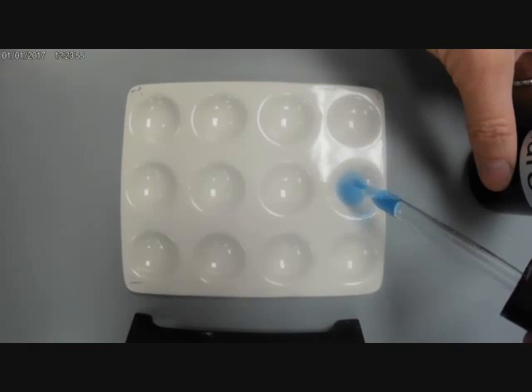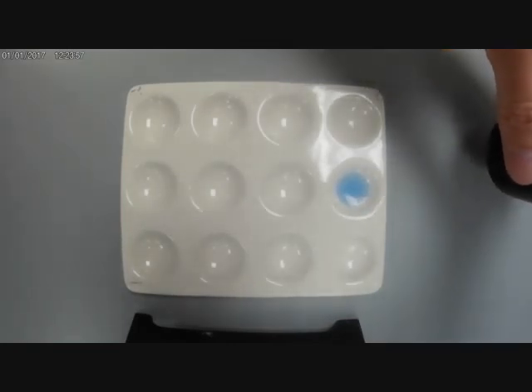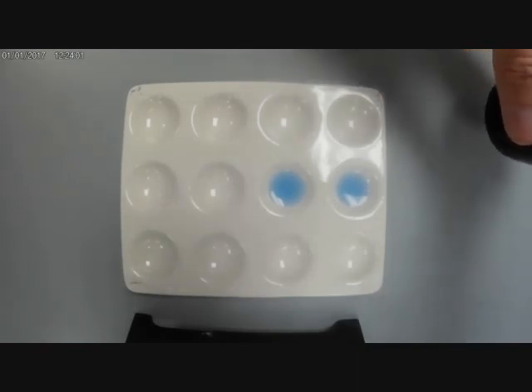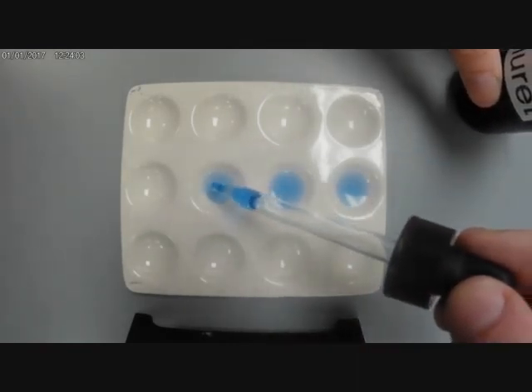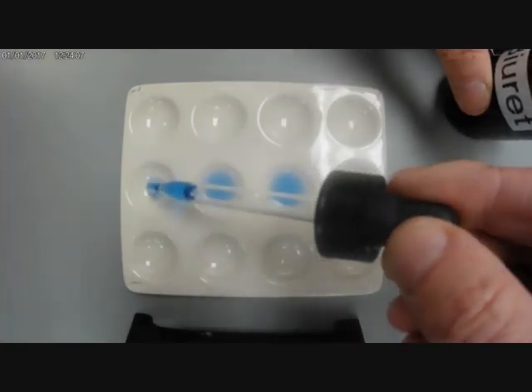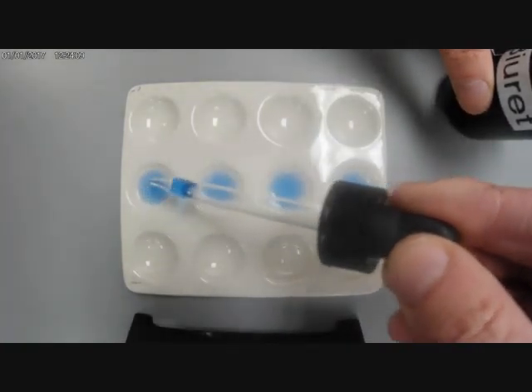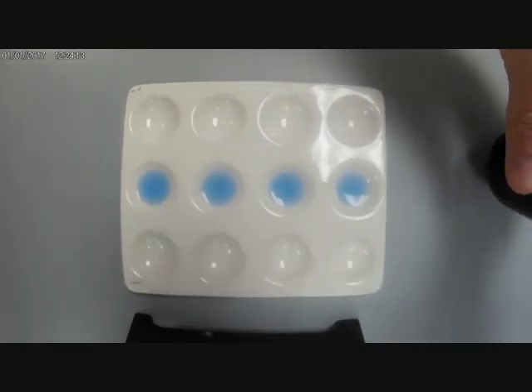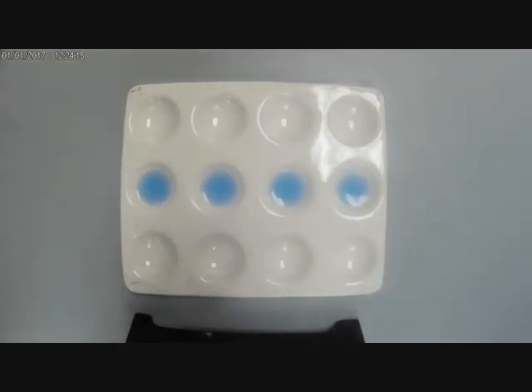I'm going to put some drops of Biuret in the first, second, third, and fourth. You can see I'm putting about three or four drops of the solution, and this is the color of the solution on its own, into the dimples ready to do four different tests.